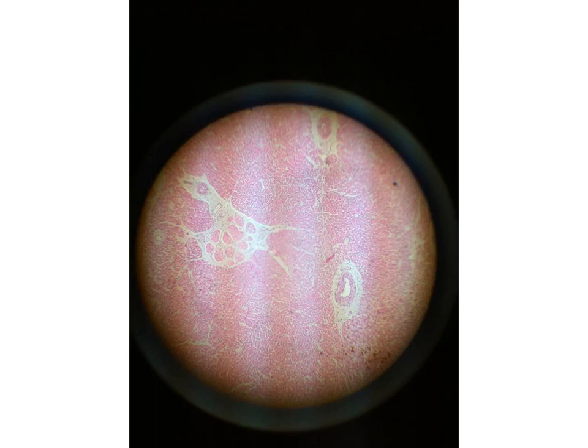This slide is different from the previous because it is just one bundle, not many bundles. And in this bundle you will notice three evident things. We will notice these fibers, which are larger than the others and surrounded by a connective tissue. You will notice this blood vessel, one or two, and you will notice the transversely cut cardiac muscle fibers, which are much smaller than the Purkinje muscle fibers. So this slide is the moderator band.